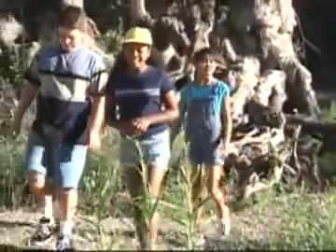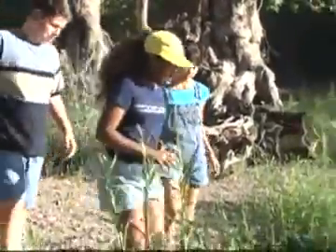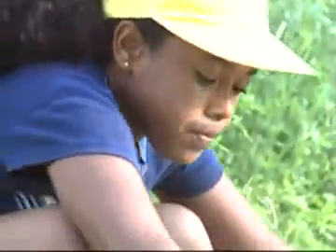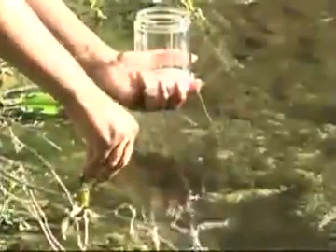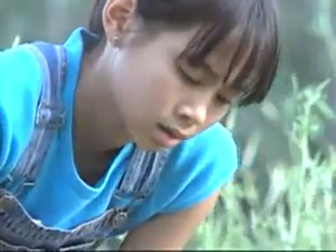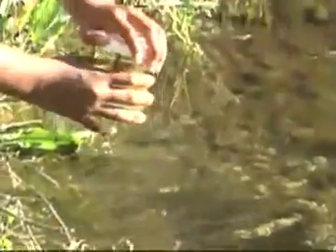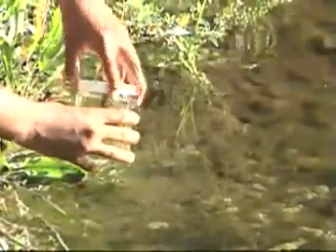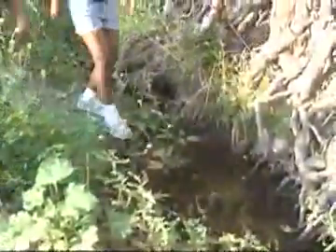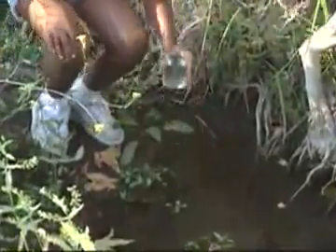The journey into a drop of water begins with a visit to your local pond. These students are collecting pond water to study later at school. They start by collecting some pond scum. This is usually filled with microorganisms. Then they add water. Finally, they cap their jar. There's enough air in the water to keep the organisms alive for a day or two. They'll also collect water from several spots.